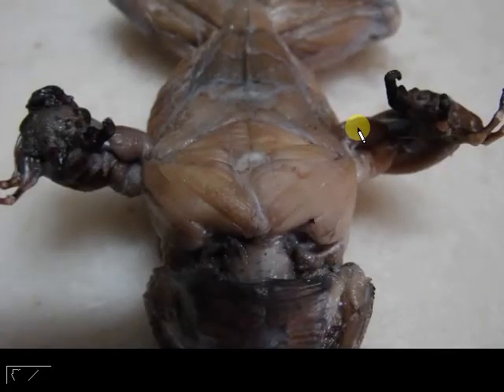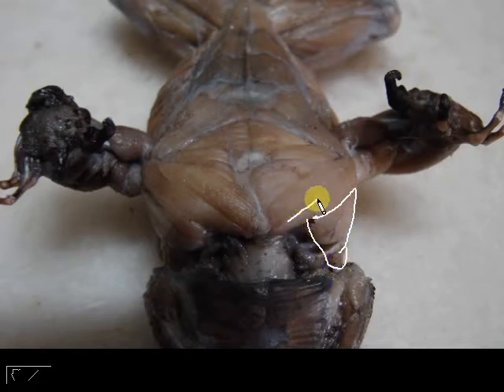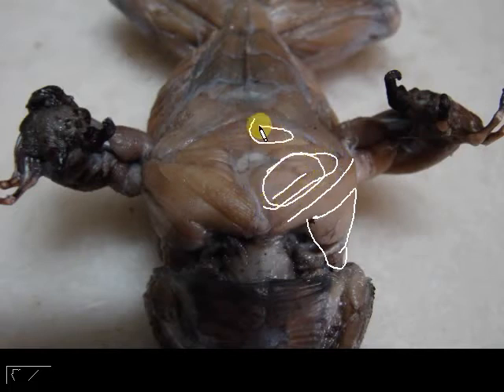Oh wait, there's a different view. Sorry, I forgot. So right here, this part would be your deltoid. Then this one would be your coracoradialis, and then the rest would be the anterior pectoralis, right there. Then that would be the middle pectoralis, and that part would be the posterior pectoralis, and then the rectus abdominis, the ones that I am dotting, the linea alba, which is now black, the inscriptiones tendinae, and then of course the external obliques.